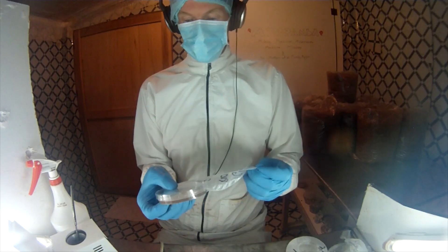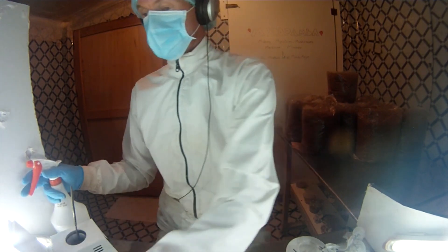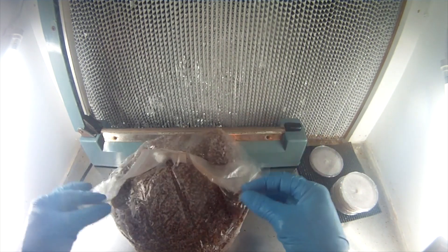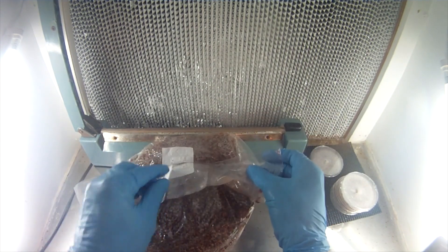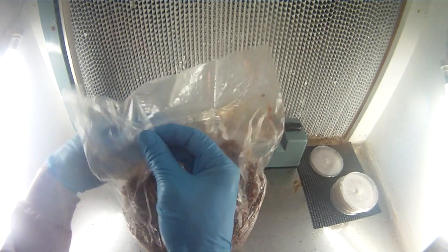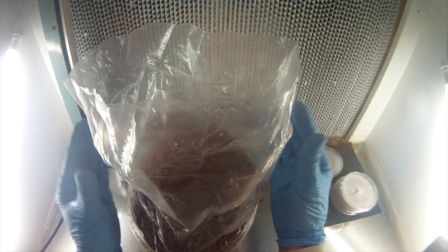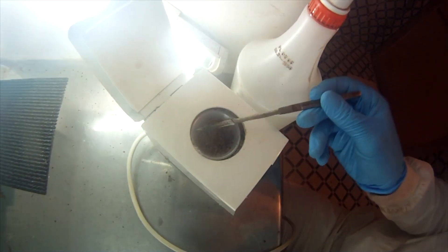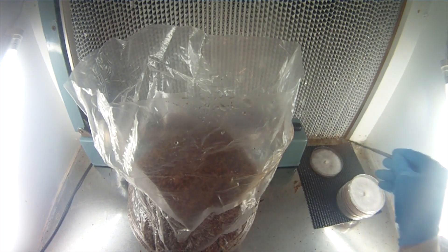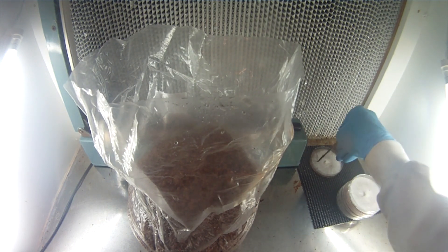I use alcohol a lot. There's a nice example — spray those things, make sure they're good. You can use as many petries as you want to transfer into grain. Obviously, the higher concentration you go, the faster it's going to run, but you can go with just one petri. You can do different size grain blocks. This is my sterilizer for my scalpel. Heat is the best way to clean. Now I'm just cooling down the end of that scalpel right in the middle of that agar.